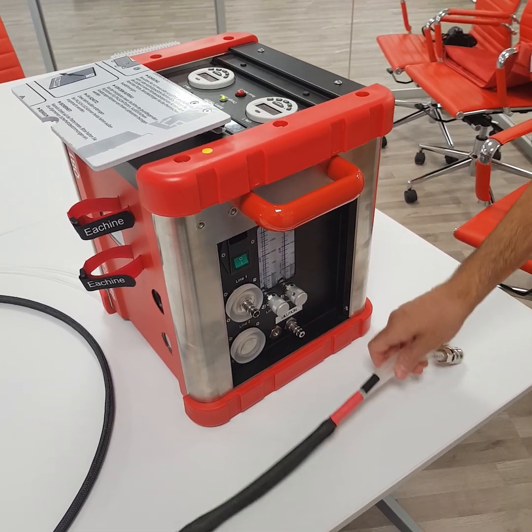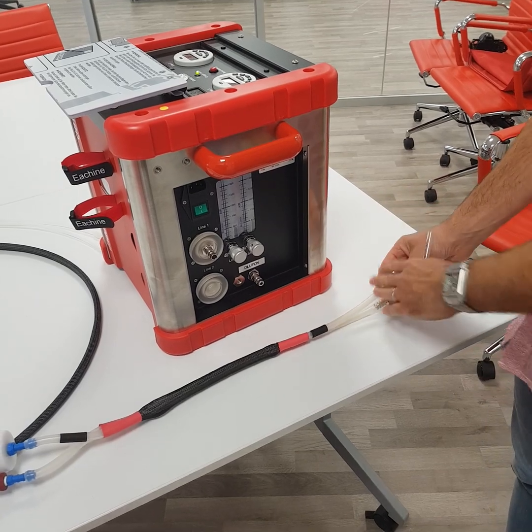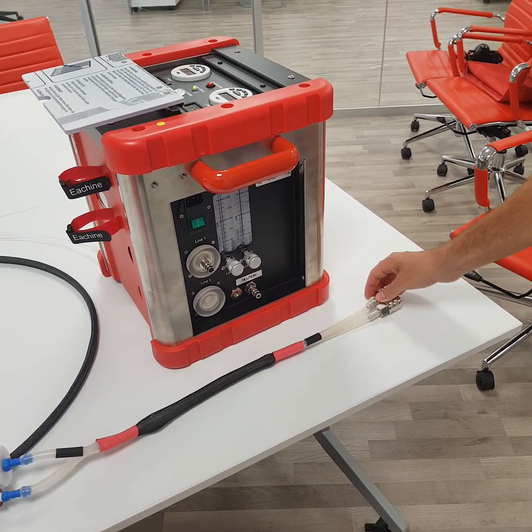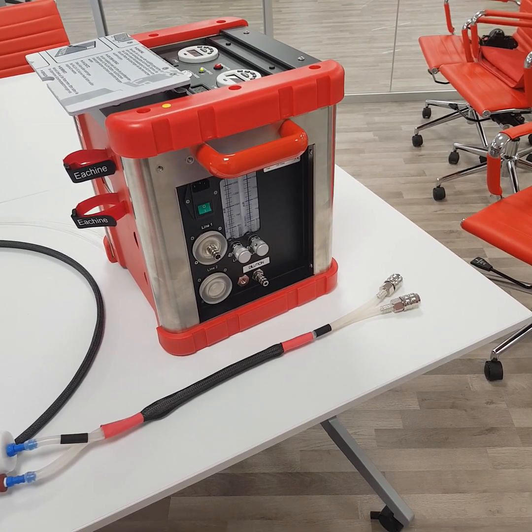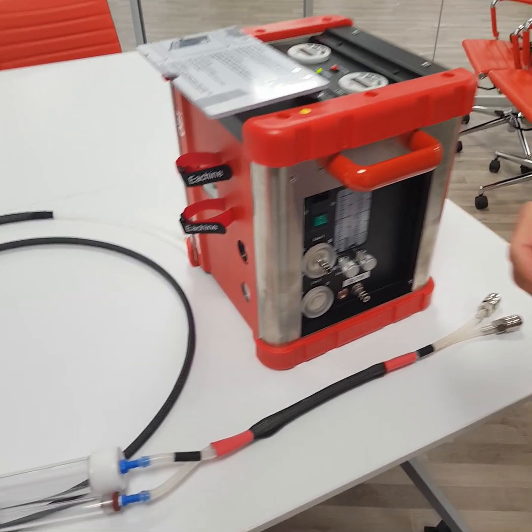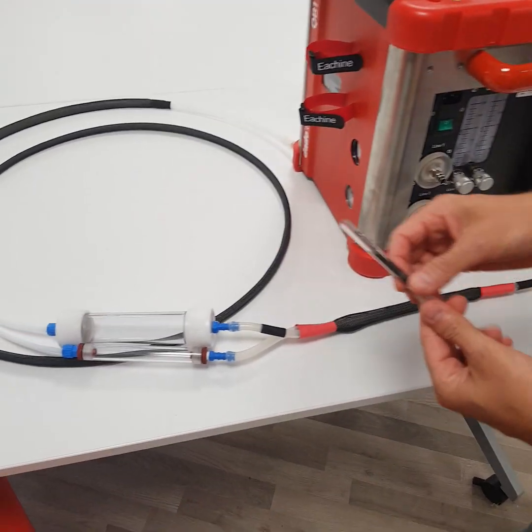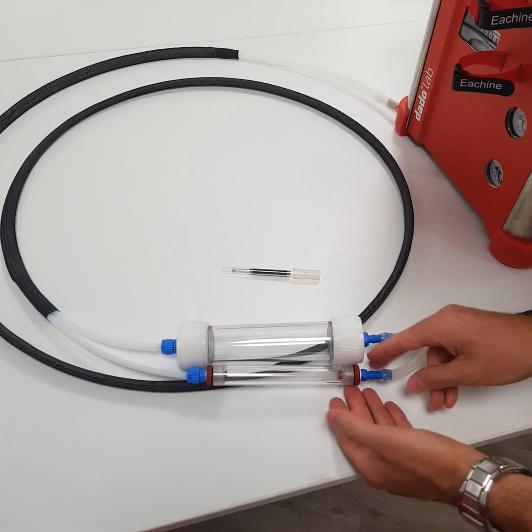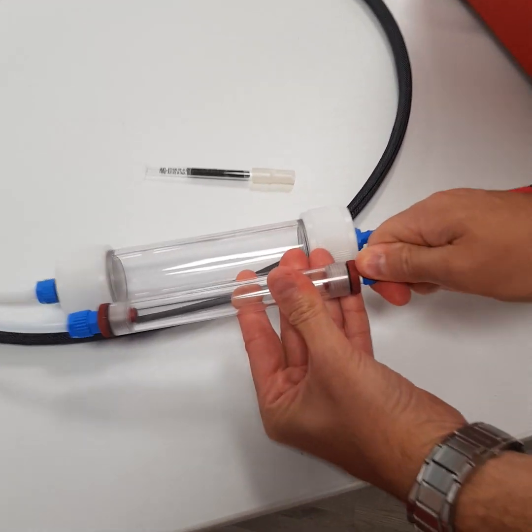We will take care of the connection cable in order to make the flow between the sampler and the chain through the sample probe. First of all, my suggestion is to take care of the charcoal filter — it's an easy and very simple operation, but it's good to see just once.